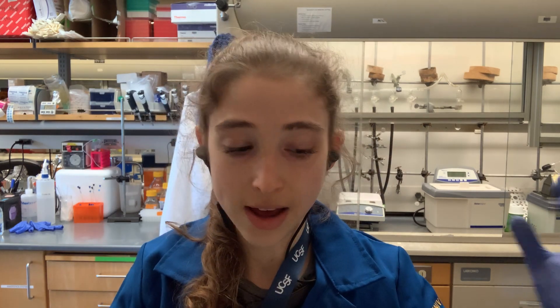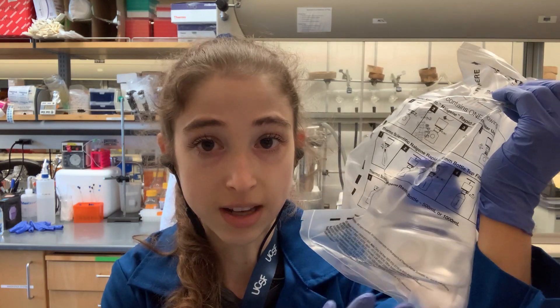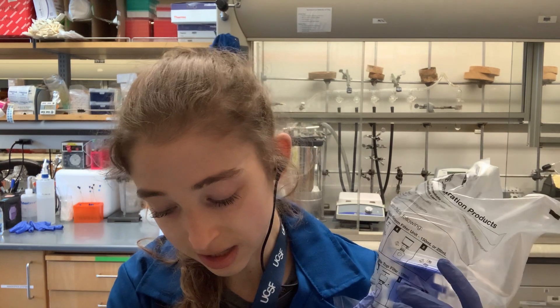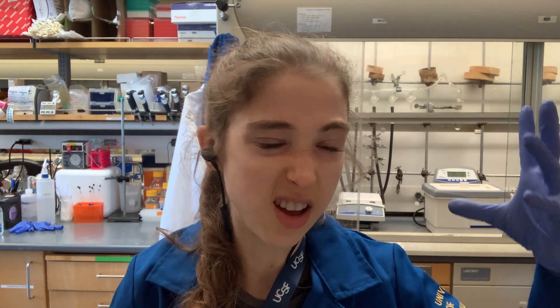When using sterile vacuum filters, the bottom collection container can also be sterile — great for cell culture. Other sterilization options include autoclaving. For small volumes of solutions like salt buffers, syringe filters are typically the go-to method and are really practical for quick sterilization in the lab.